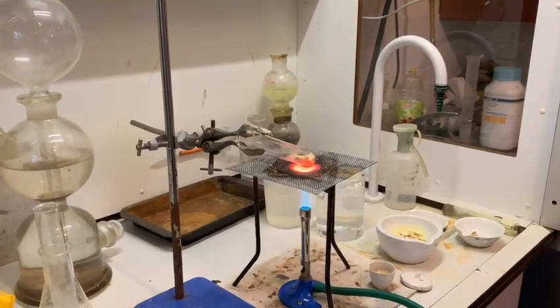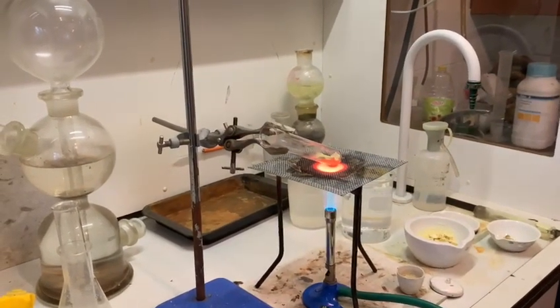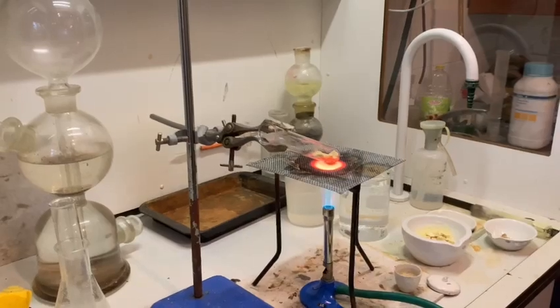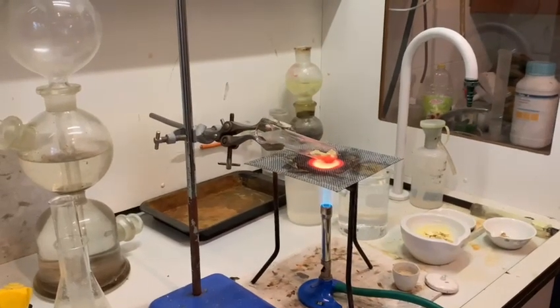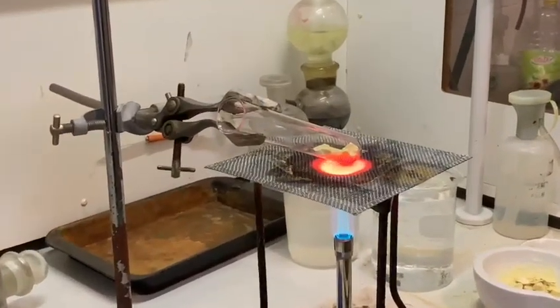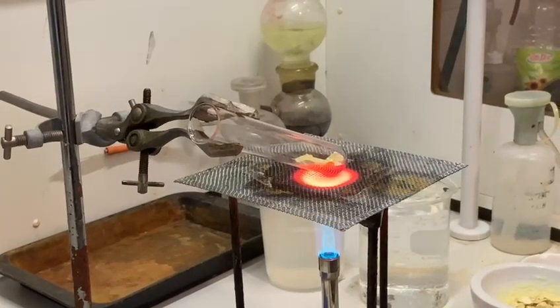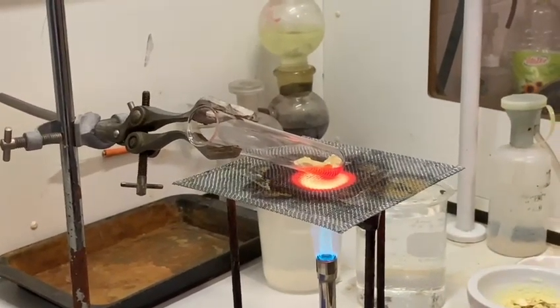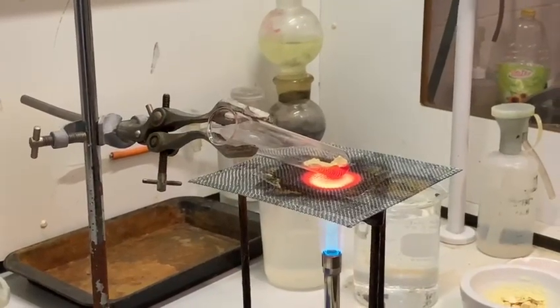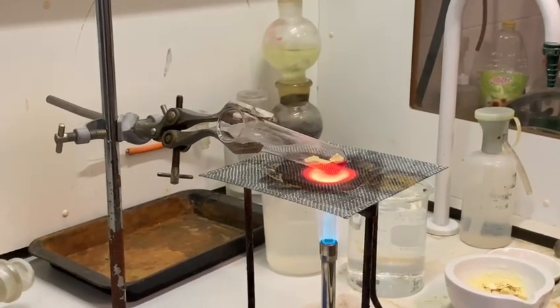Already you're beginning to see something happen — it's beginning to move, so it's beginning to melt. Sulfur forms a very yellow, runny liquid at about 116 degrees.